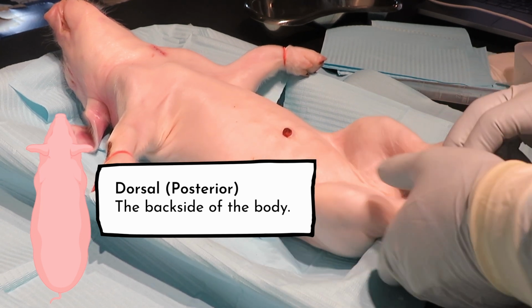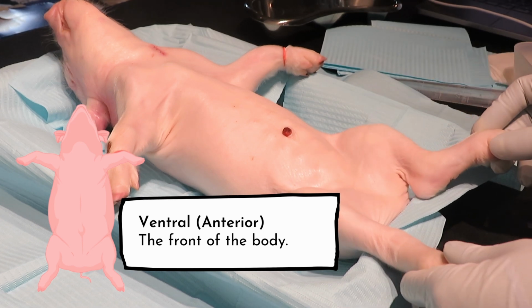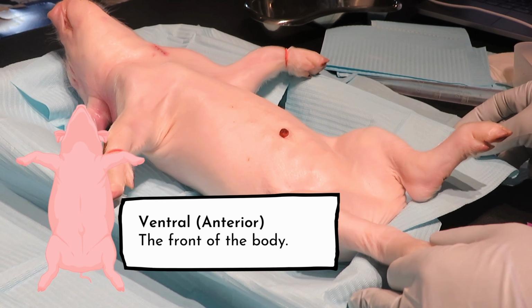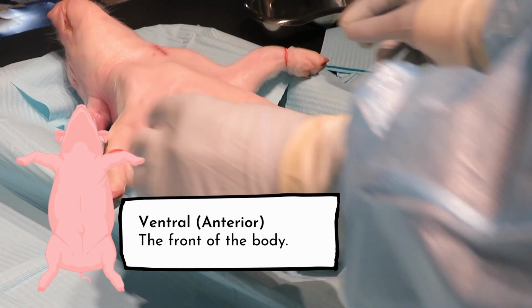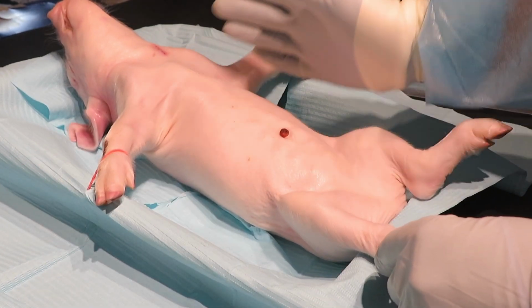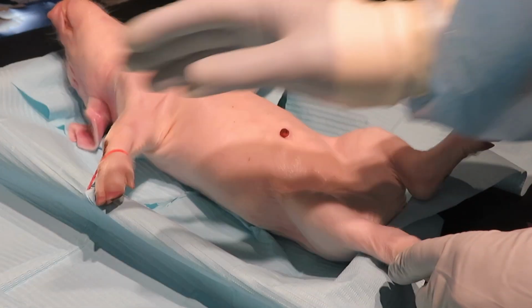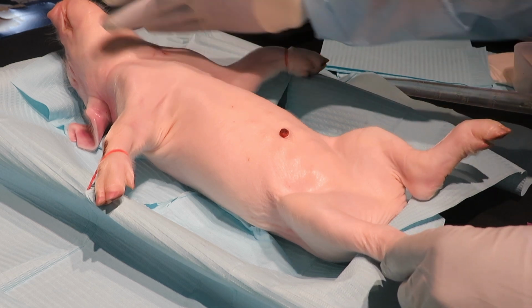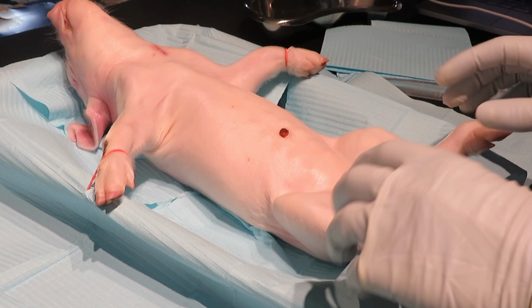So this is the dorsal and the ventral side of the body. So now, the piglet here is in the anatomical position, or the standard position of the body, which means the body is in a supine position. This is her left side, and this is the right side of the body. Well, this is her superior side, and this is the inferior side.